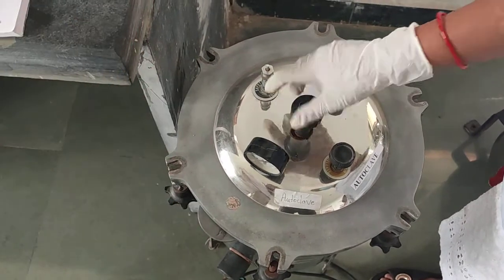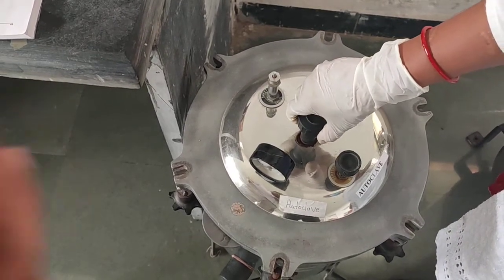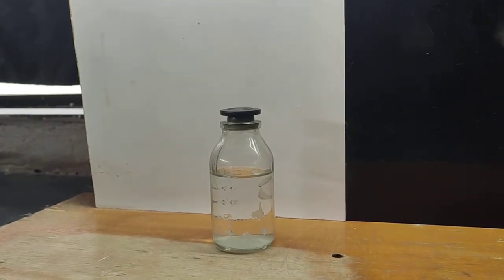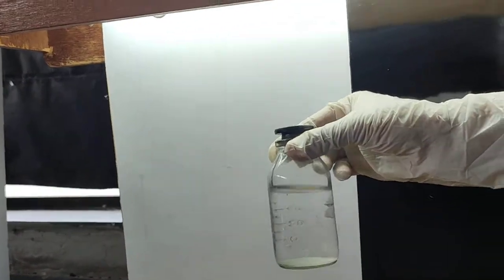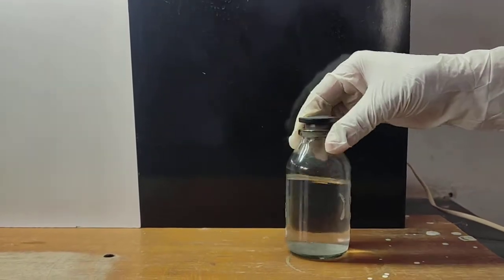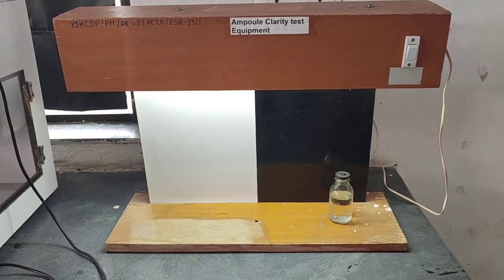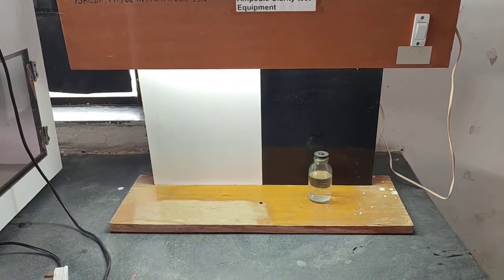After autoclaving, we open it and retrieve our sterilized intravenous injection. Then we perform quality control testing — specifically the clarity test — to check for particulate matter. Black or colored particles are checked against a white background, and white particulate matter is checked against a black background. If particulate matter is present, the preparation is rejected.